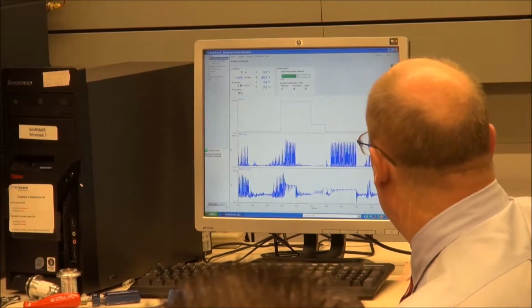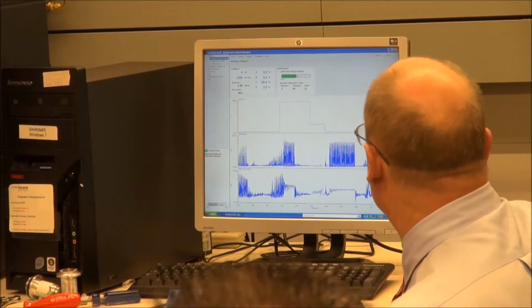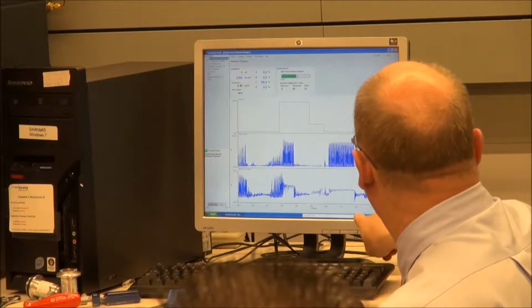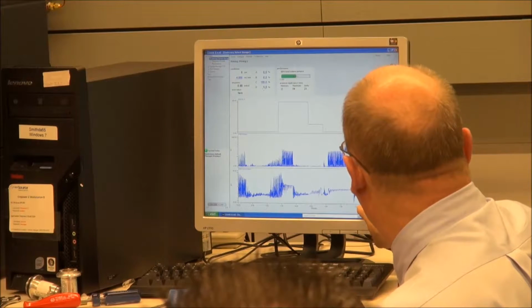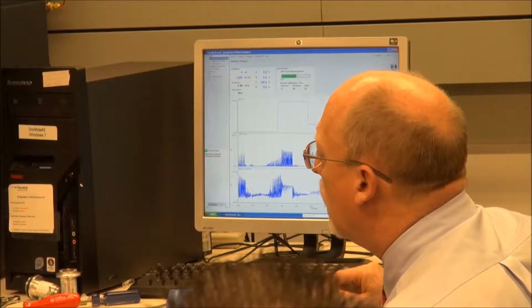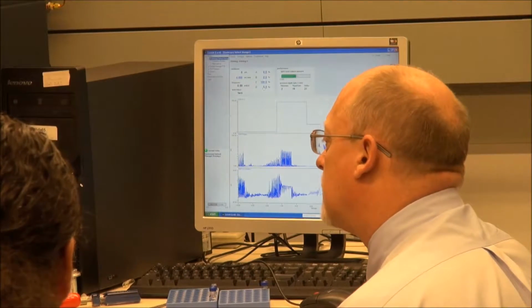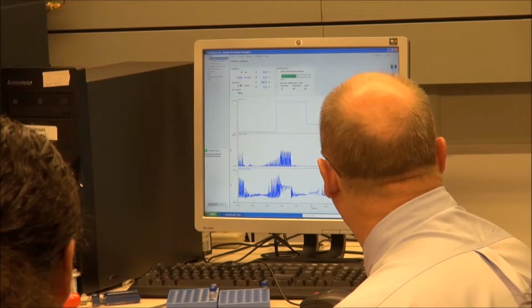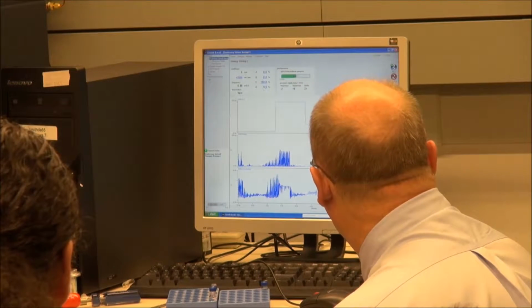We still have to purge out any air that was inside of the stock there. Yeah, and we're about to be done. We've got a lot of air in the tube. Just be careful because that's ACN on your fingers. Carcinogenic.